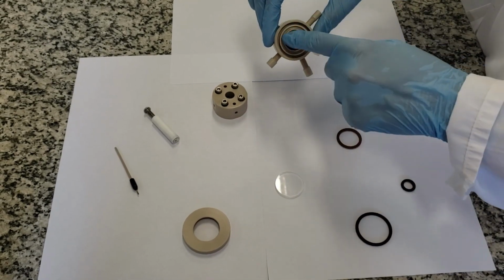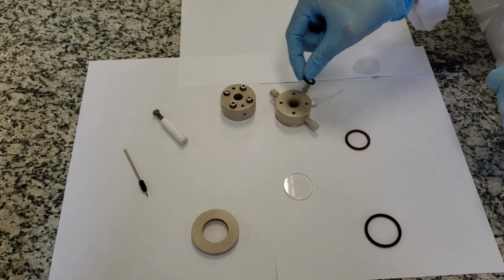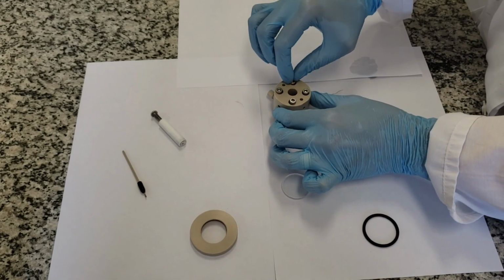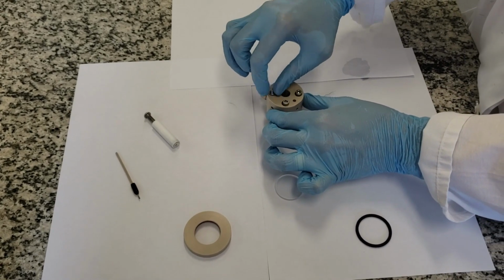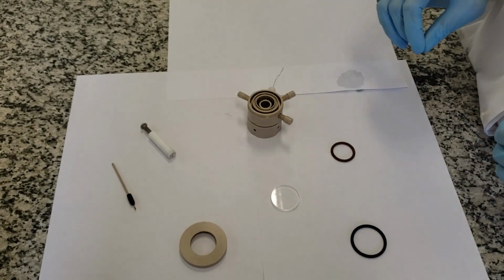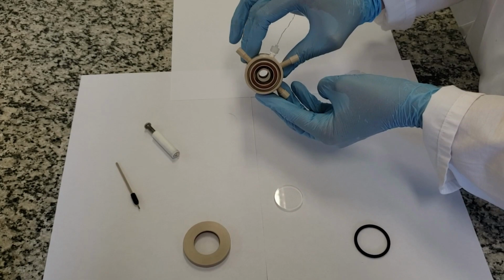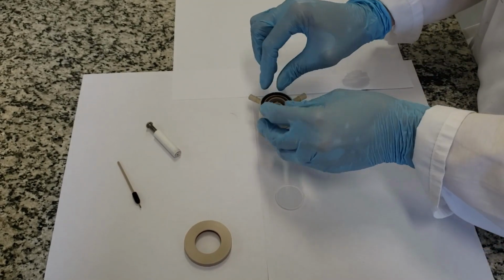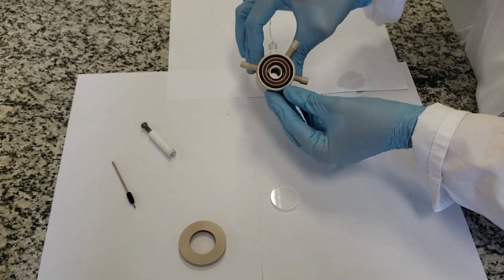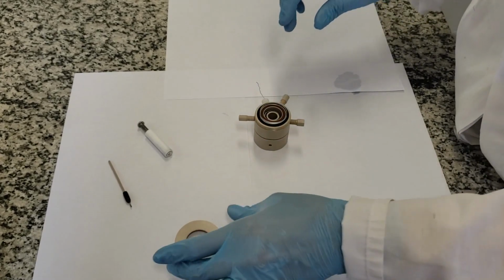We have recorded a video for you to understand how to set the cell. First, we are putting together the compartments of the cell body. Look that we fix them using screws. Then we insert the bigger O-rings in the front of the cell. We have two O-rings simply to permit to adapt windows with different sizes. Look that the window is placed on the O-rings and then pressed and attached with the lid.